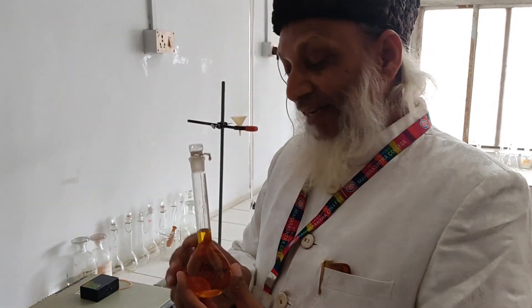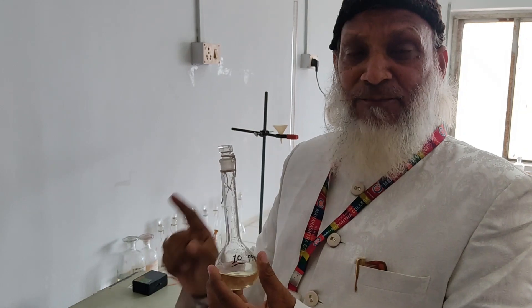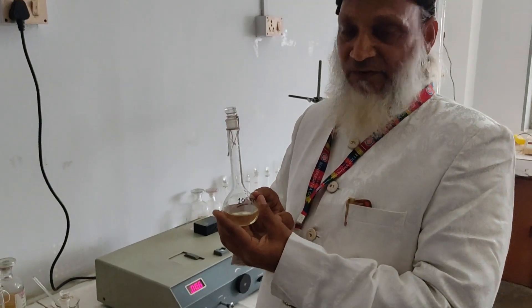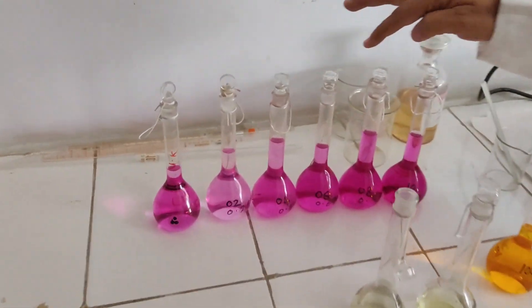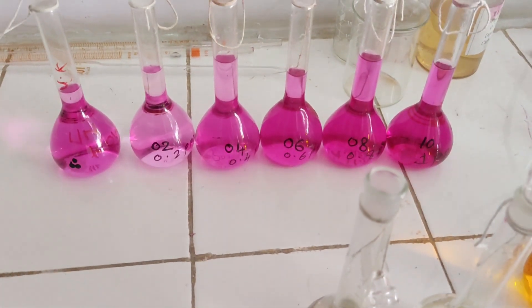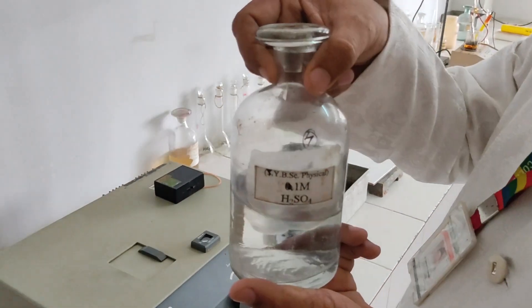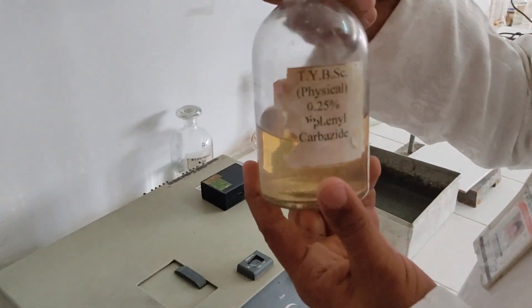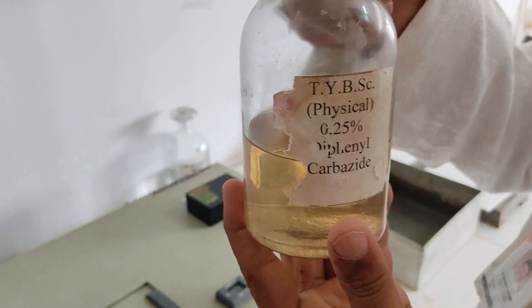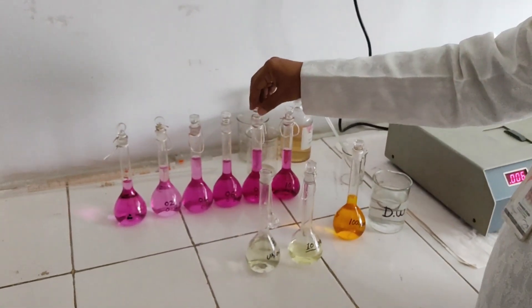From the 10 ppm solution, take 2 ml, 4 ml, 6 ml, 8 ml, and 10 ml. To each, add 10 cm³ of 1 molar sulfuric acid, then add 2 cm³ of 0.25% DPC (diphenyl carbazide). Dilute each to 100 cm³ with distilled water. These give concentrations of 0.2, 0.4, 0.6, 0.8, and 1.0 ppm.